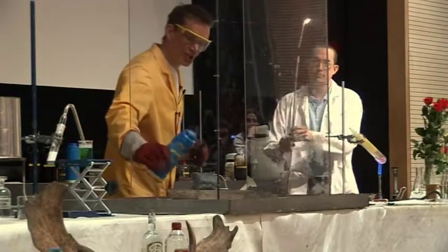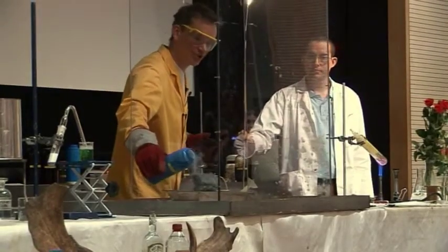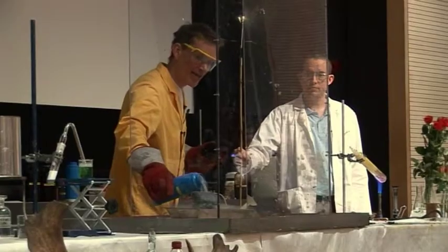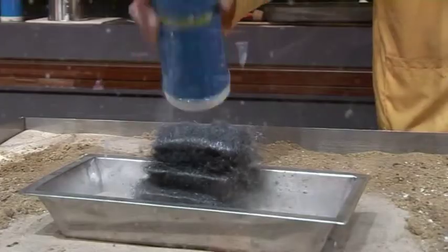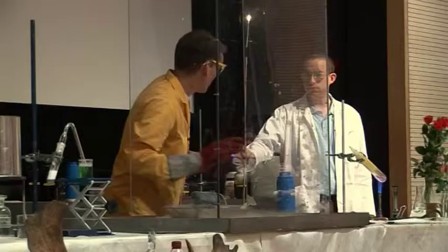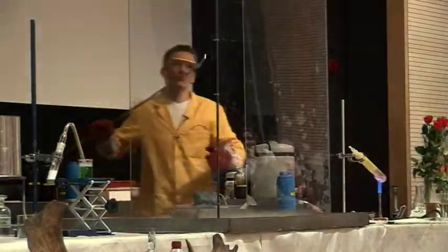Liquid oxygen doesn't burn at all by itself. It doesn't do anything, but it does allow things to react with it — it does allow things to burn in it. Even this iron here can react with the oxygen. So I've added some liquid oxygen, and when the lights go down, we'll add a light, and you may see the combination of the iron and the oxygen.